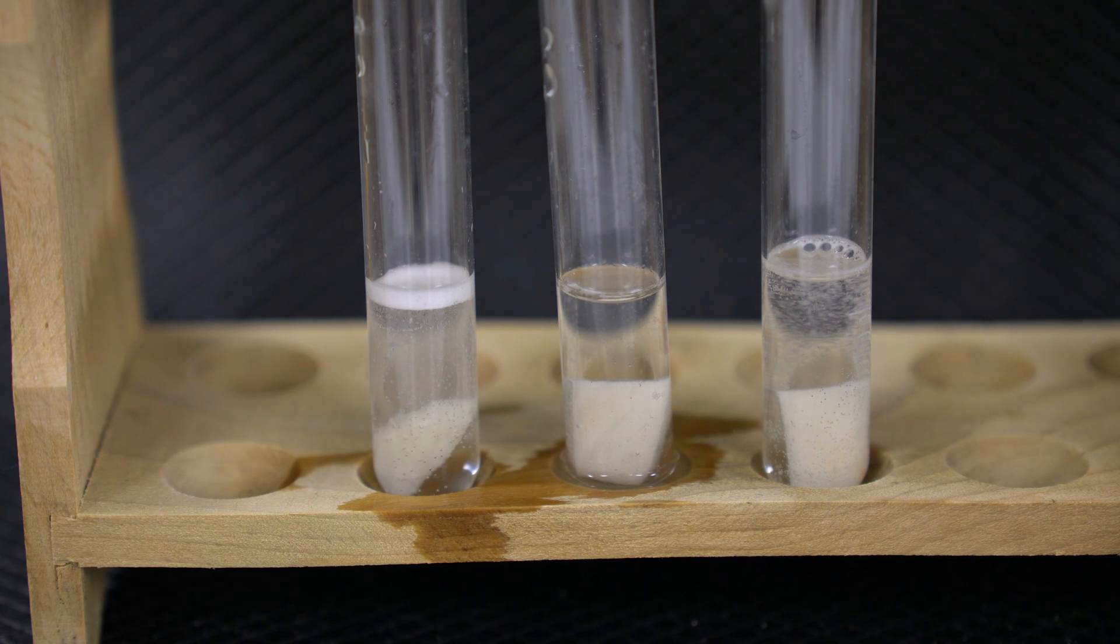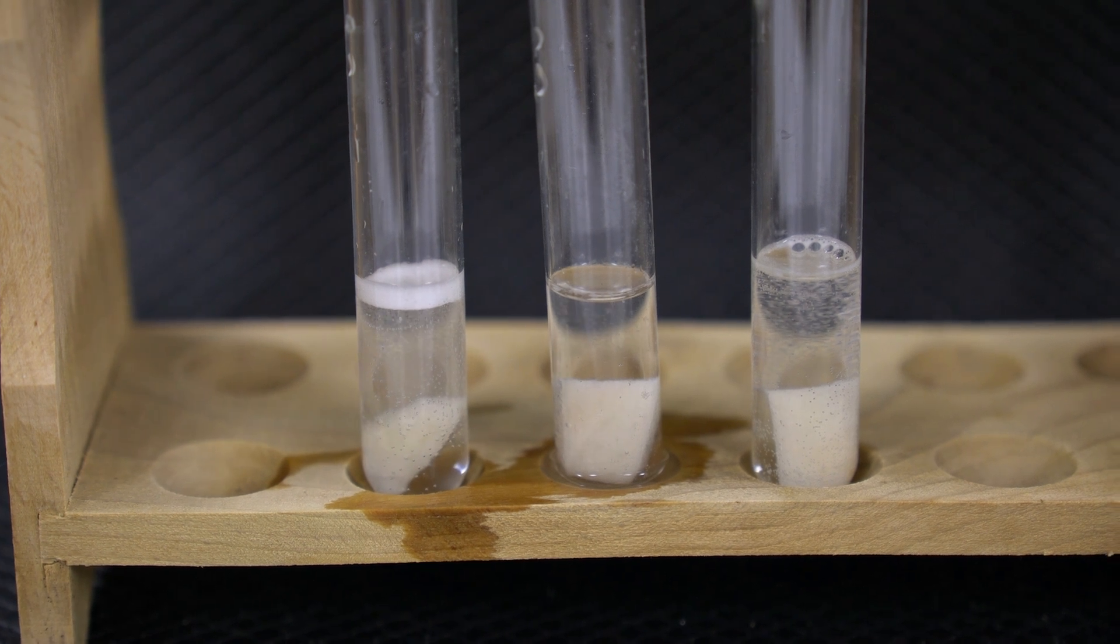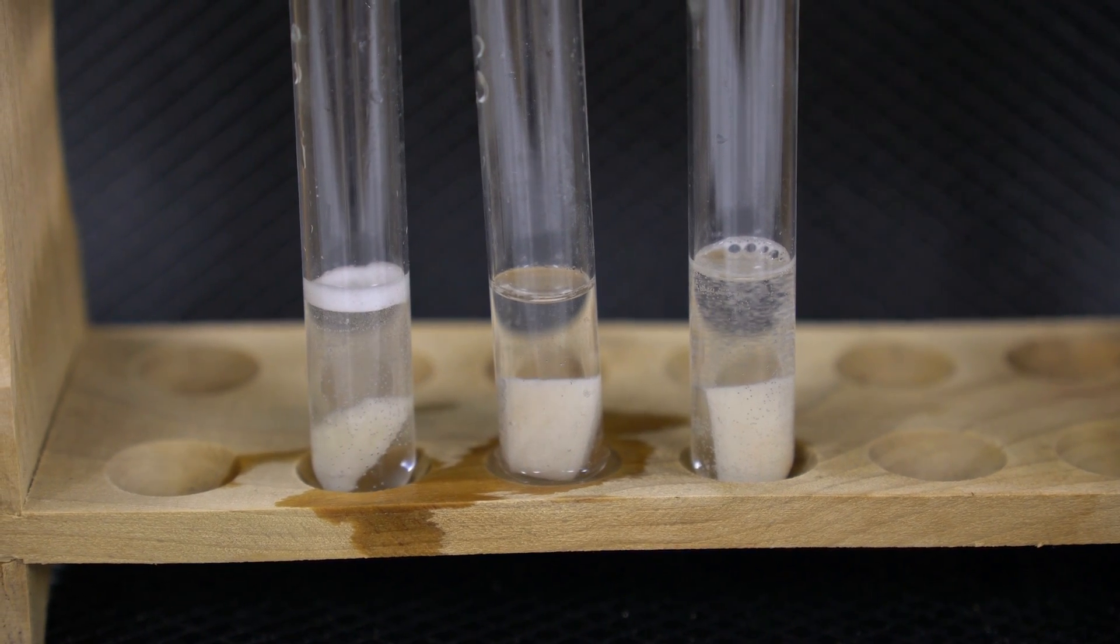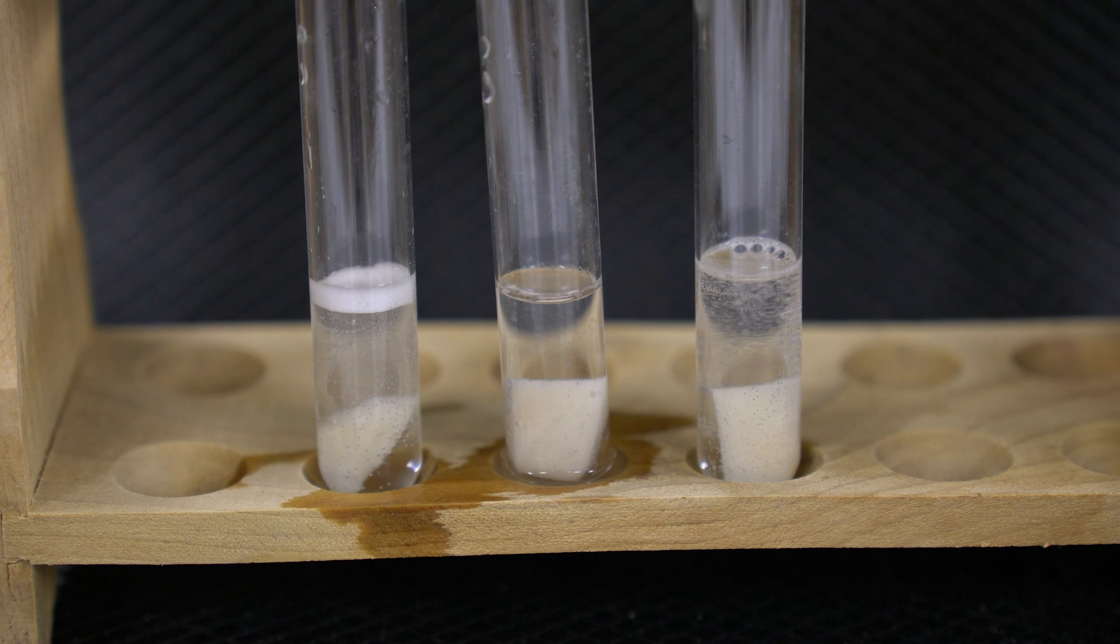This goes back to products and reactants and how much we have of each. When one is used up, it becomes a limiting reactant. This is just a great visual to show that, looking specifically at the catalase enzyme.